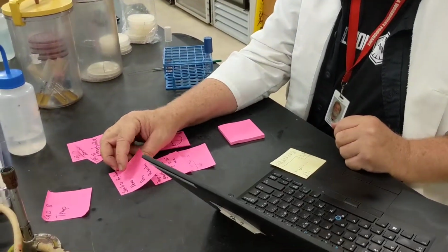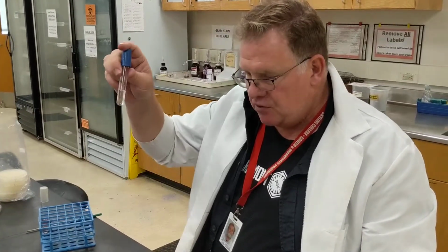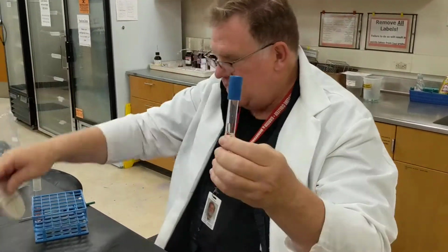That is a demonstration looking at the effects of dry heat and also the effects of wet heat. We're also going to look at the effects of temperature. And so what you're going to do is have a tube, and then put it in a water bath, expose it to different temperatures, elevated temperatures.